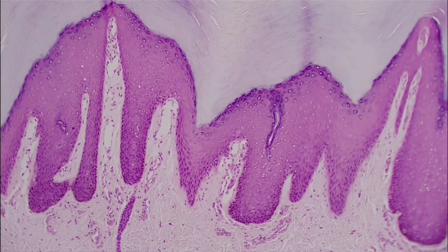This is going to be our keratinized stratified squamous epithelium. And so keratinized, the way I like to think about it is that these cells are dead, right? We can see that there's kind of like a hole where our organelles should be and things like that. And we can see it gets really thin, really flaky. These are often pretty squished and they're kind of just devoid of life.